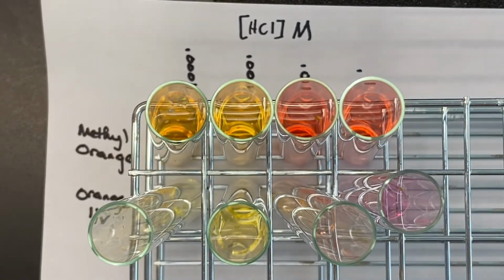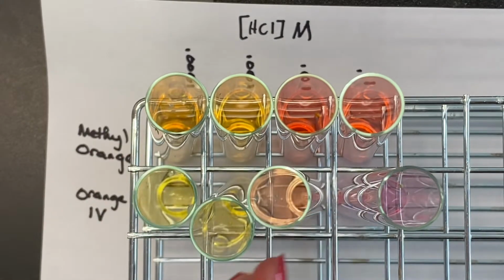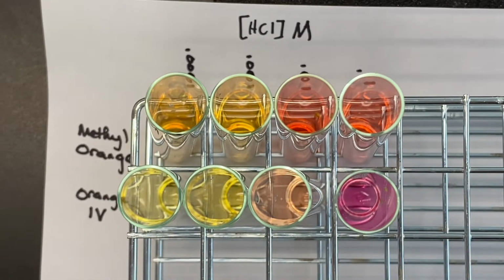So we are now going to, so these are your standards from part 1. We're going to use these colors and compare them to the weak acids. So HCl is a strong acid, so it 100% dissociates. That means that whatever the concentration of the acid is the same as the concentration of the H+ ion, because you have 100% dissociation. In part 2, we're going to use weak acids and bases. Those concentrations of H+ are going to be less than the acid concentration because weak acids don't dissociate 100%.